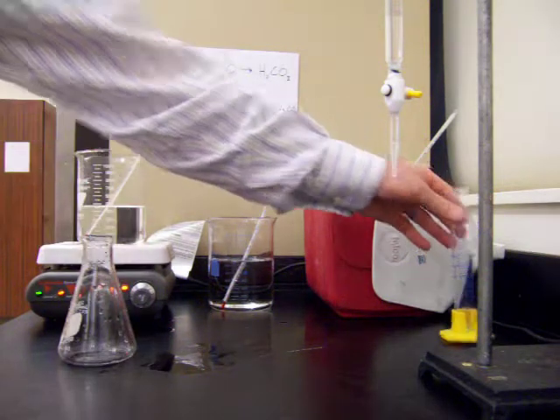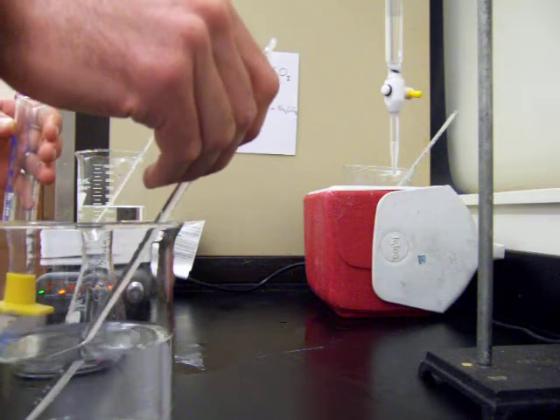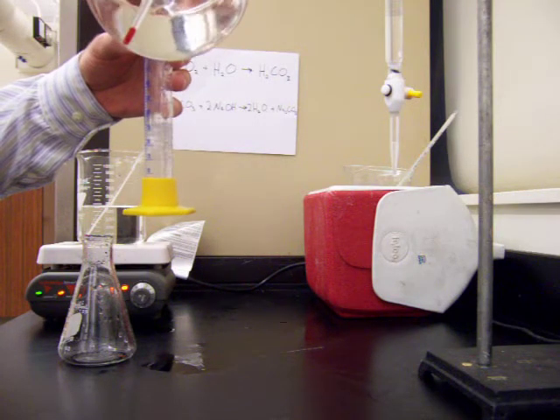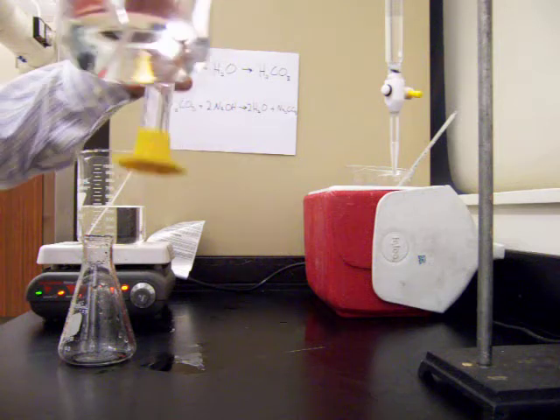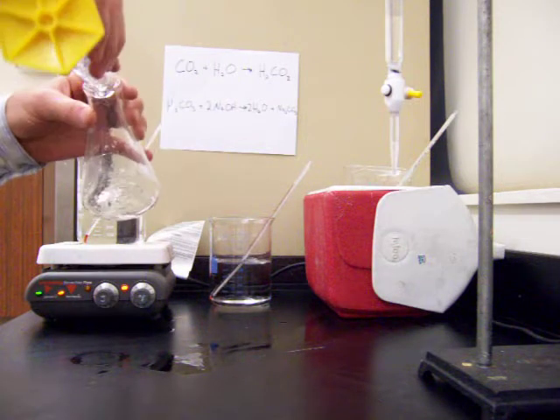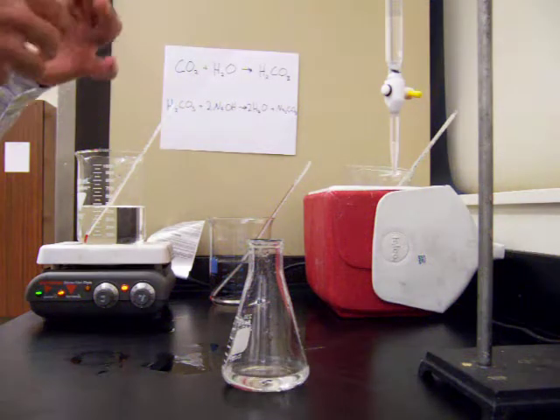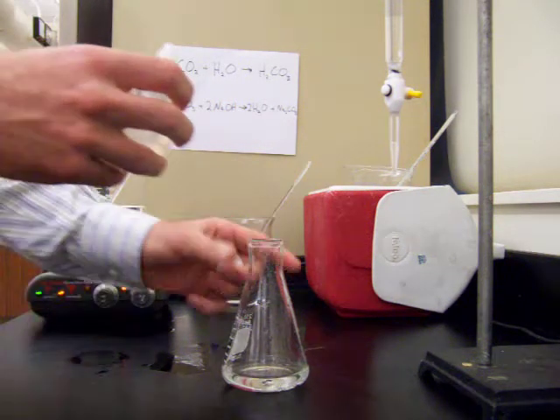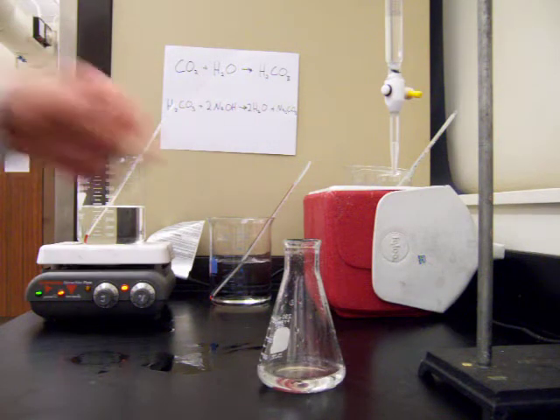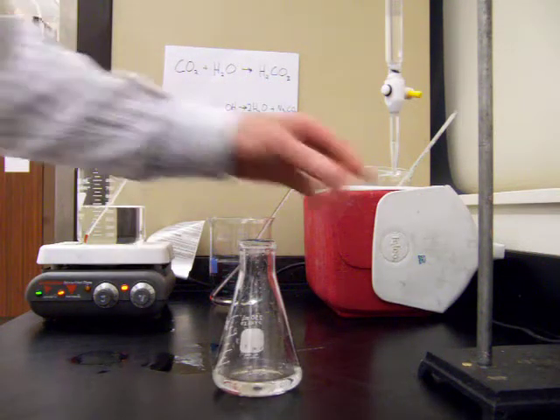We're going to start with the room temperature water. We'll measure out a 50 milliliter sample — the temperature today is about 19 degrees Celsius — and put it in an Erlenmeyer flask. Before the titration we need to add a little bit of indicator. This is phenolphthalein, which will allow us to see the neutralization reaction. Just a couple of drops — nothing happens in the acidic solution, but when it becomes basic it will turn pink.